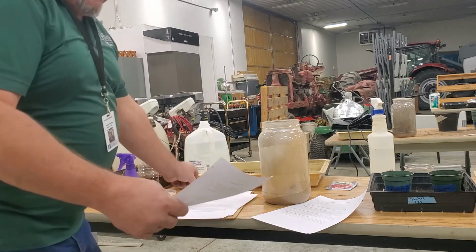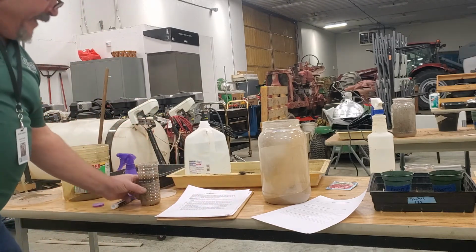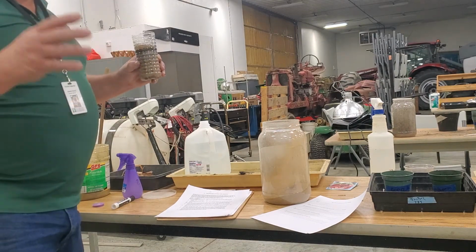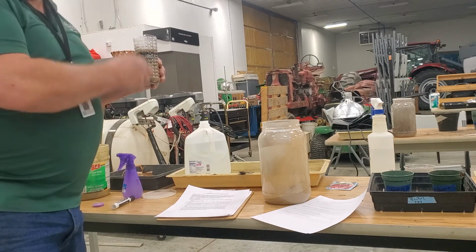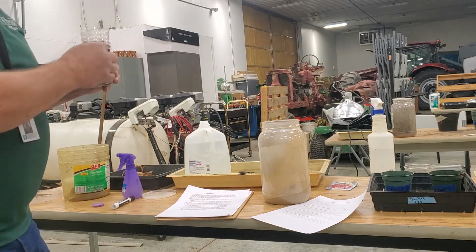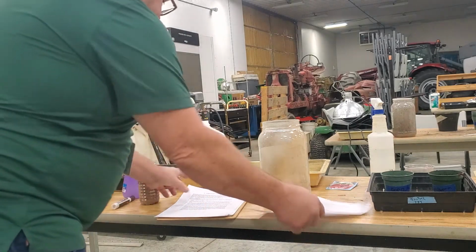So right now there's really nothing to write down. I just wanted to demonstrate how the thing is working. So what we're going to do here is let that saturate down through there. The point we're going to show is if earthworms do what they're supposed to, they're going to eat down through there, they're going to poke holes through the soil, and they should open up the porosity, and the next time we do a wetting front, it should go through there quicker. That's the goal anyway. So that's experiment 1.